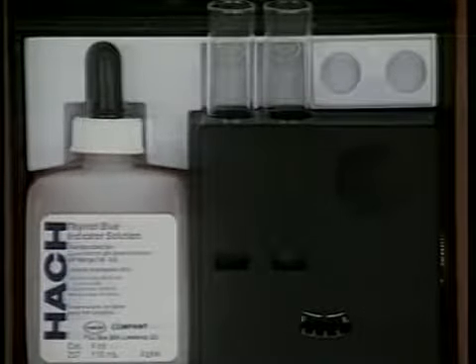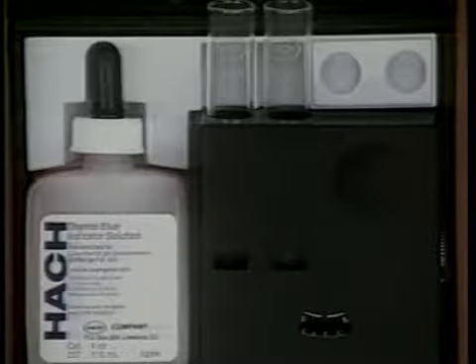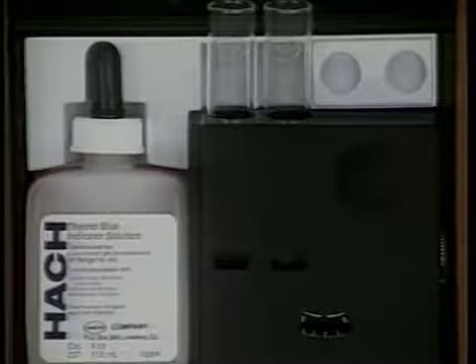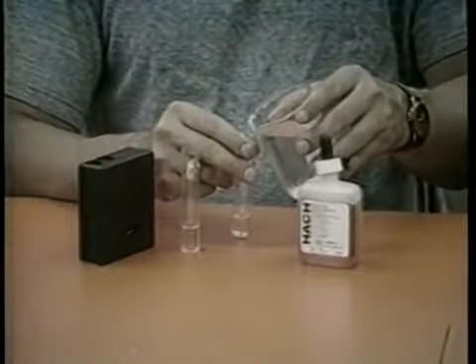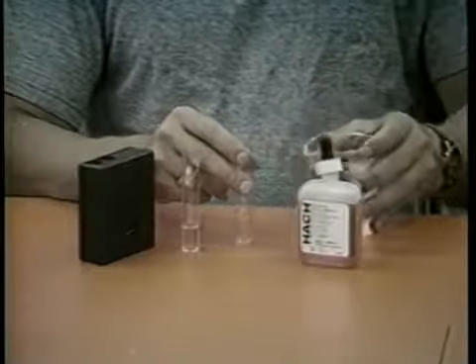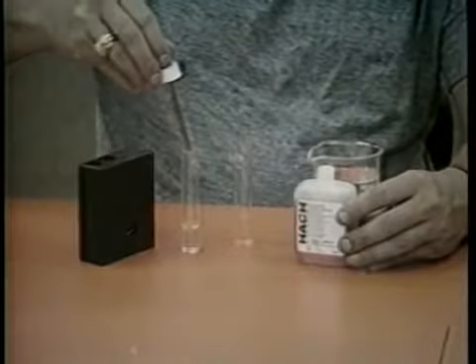It is important to remember to first check your pH using the wide-range method and then, if greater accuracy is desired, use the narrow range test. To test the pH using the narrow range method, proceed as follows. Obtain a water sample as described for the wide range test. Fill the 2 viewing tubes to the 5 ml mark with the sample. Add 6 drops of the thymol blue indicator solution to one of the tubes and swirl to mix.